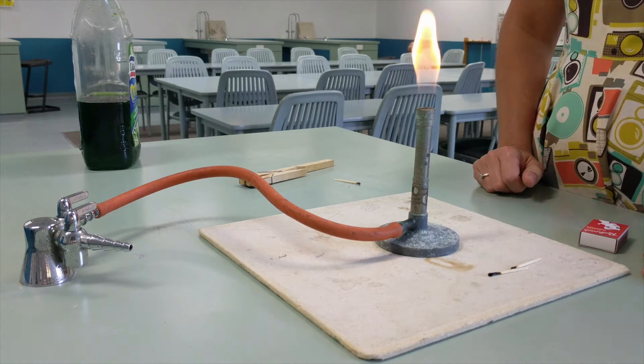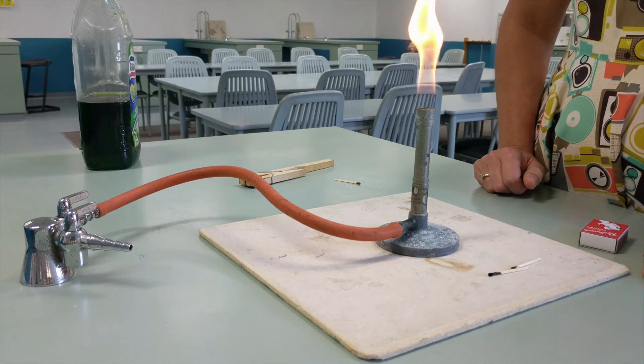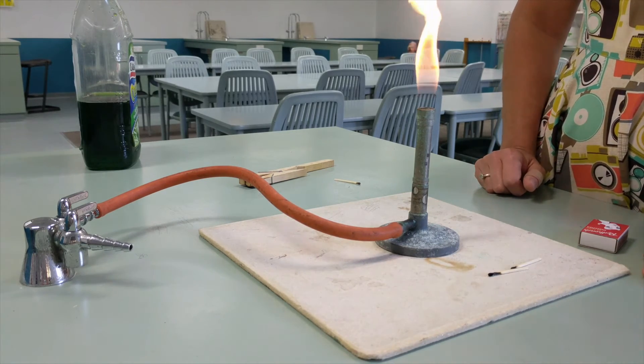This is the yellow safety flame. As you can see, it's highly visible. It's also slightly cooler so it is safer to be around.